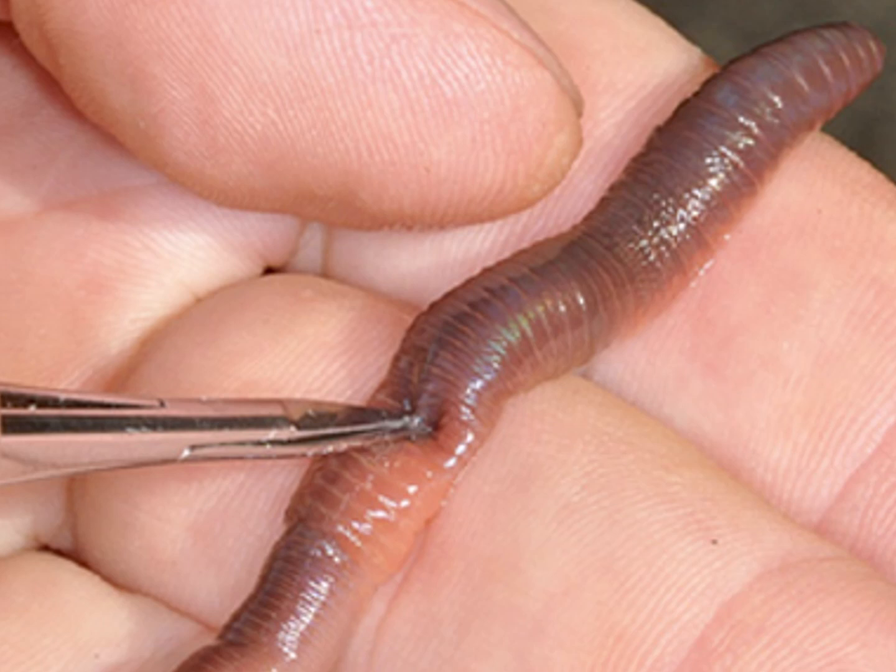So we have to hold it in one hand, and make a small slit using a scissor in the body wall in the mid dorsal line in the region of the clitellum. We first identify the clitellum, and then cut on the upper side of the clitellum toward the head side and make a slit. We have to be careful because it is a very delicate organism, so the scissor could go deep. We have to prevent internal cutting.